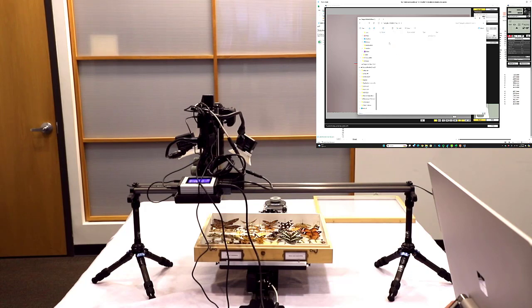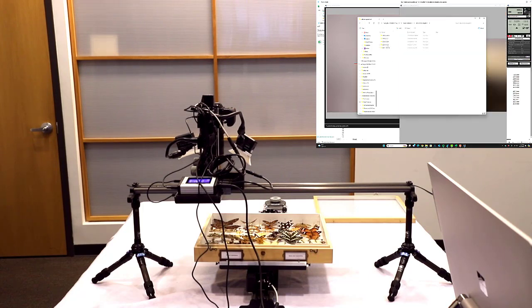We've got our video tutorials, African Lepidoptera. And when I take an image here, so I'll snap a random picture, you'll see it's going to create its own new folder according to today's date. So today's April 2nd, 2024. Because that was a test image, I'm just going to delete that.